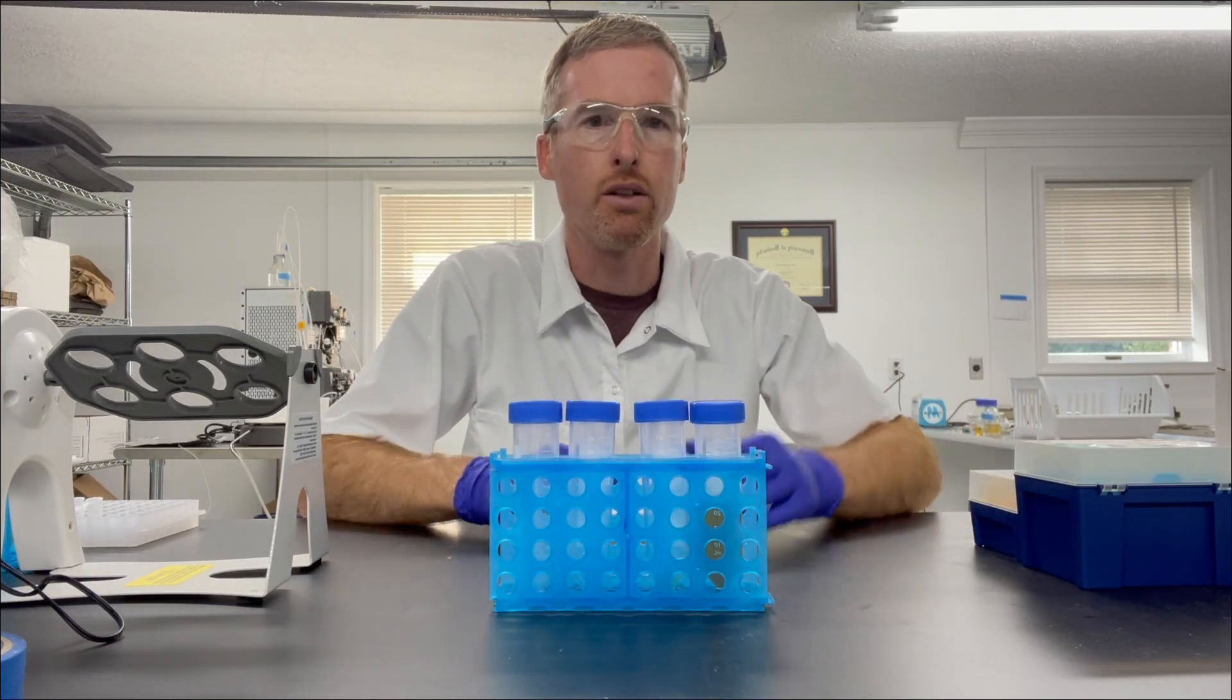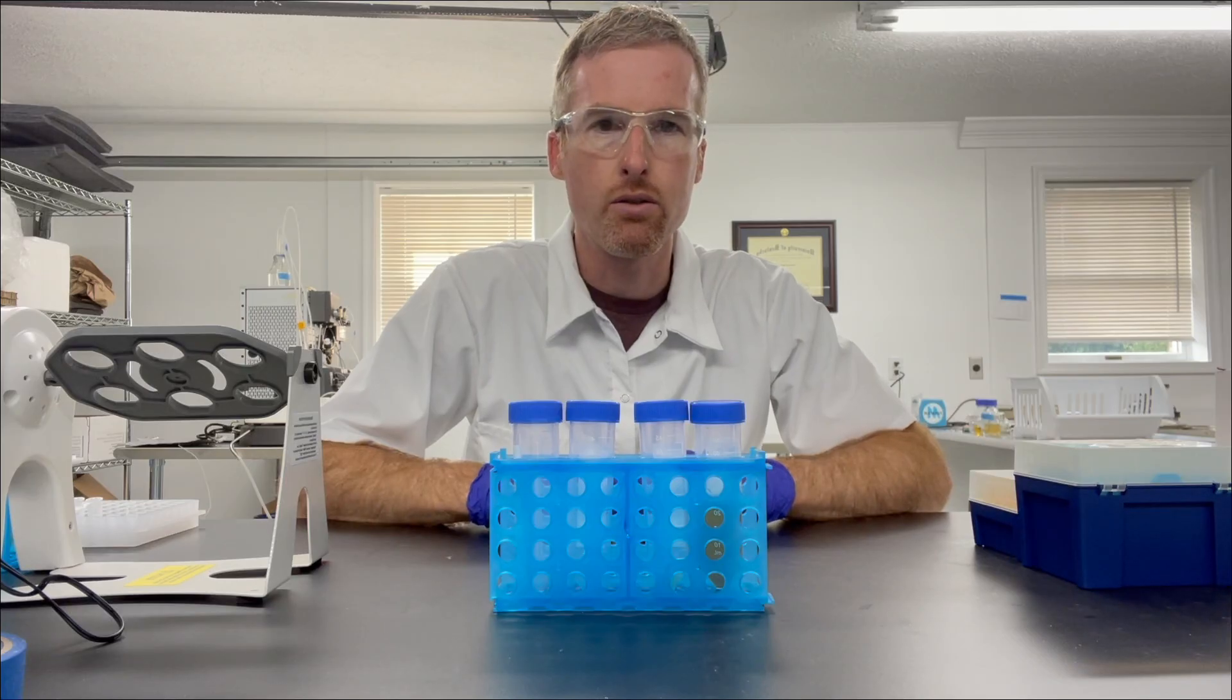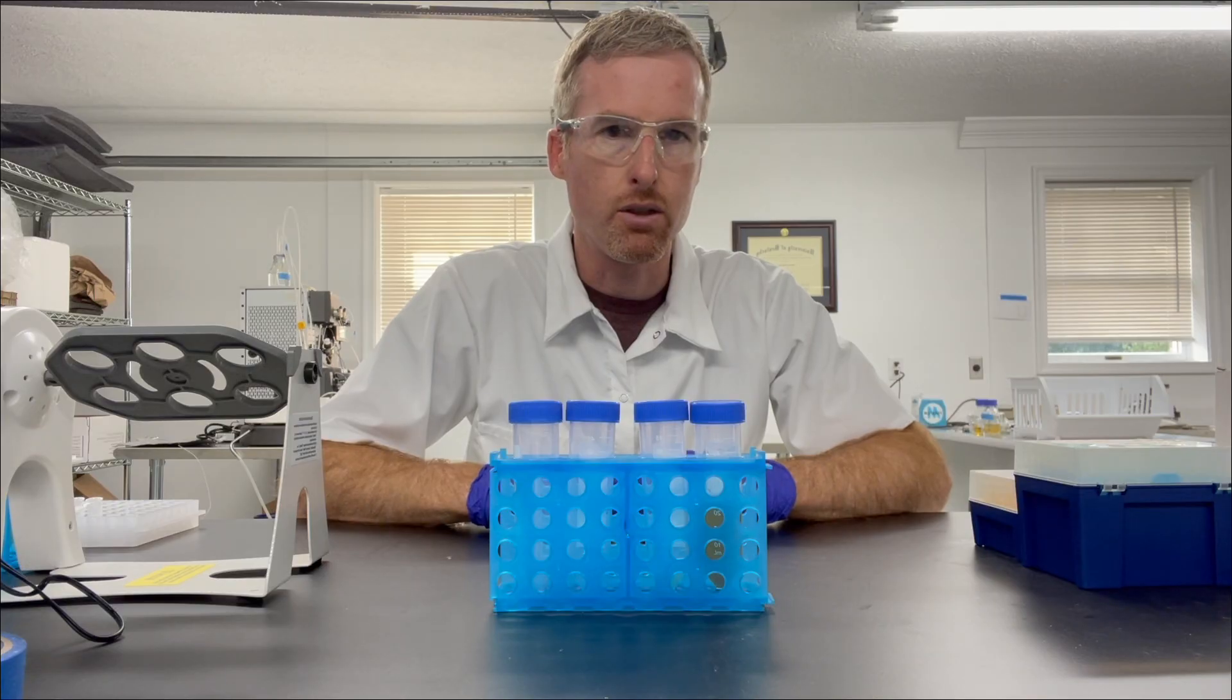Hello, Jonathan Wagner here from SolidScience.com, and I'm going to show you how to purify a his-tagged protein from E. coli.